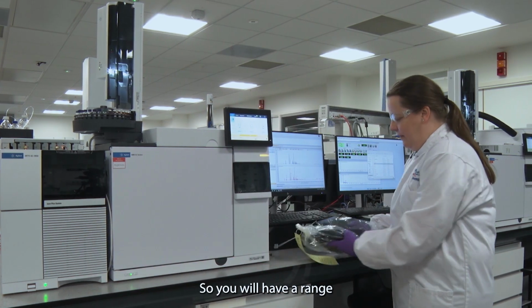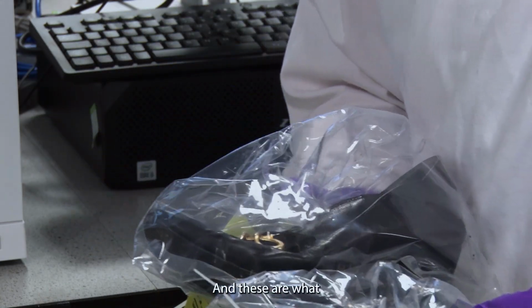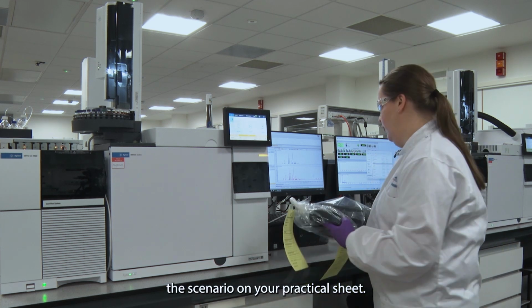So you will have a range of forensic samples that are bagged up and labelled, and these are what you're going to be analysing, and these link to the scenario on your practical sheet.